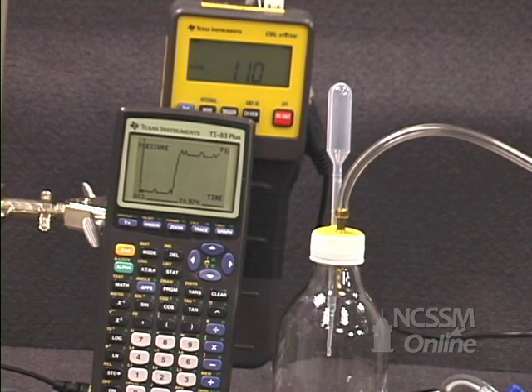We'll repeat the experiment at different temperatures. We'll record the initial pressure, the final pressure, and the change in pressure.